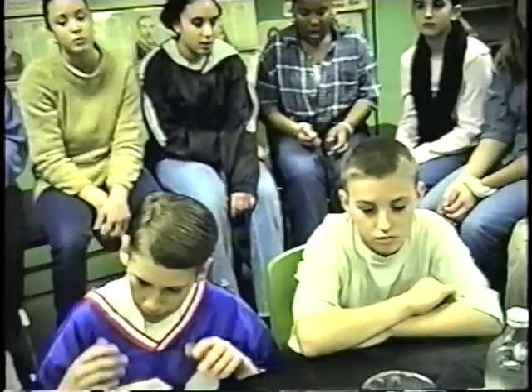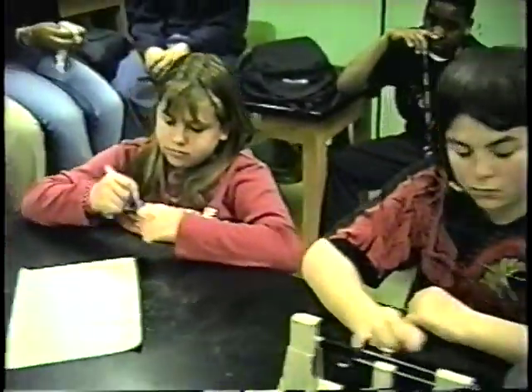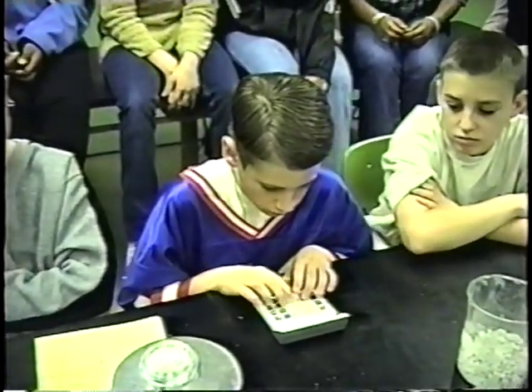And that's where you come in, Tim. So if you could plug in the watch glass one first, the rocks, and tell us what's the difference on the rocks? 28.4. 28.4, and if you could write down next to calcium carbonate, 28.4. And Tim, if you could do the same thing with the vinegar for us, difference of filled and empty, 57.8.